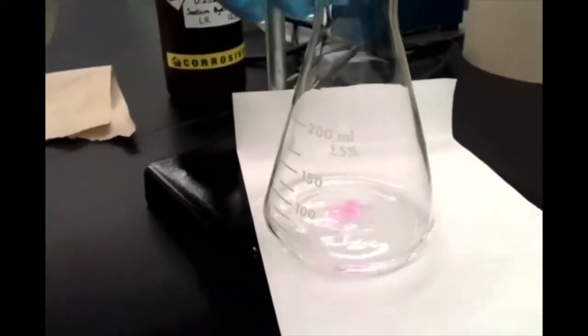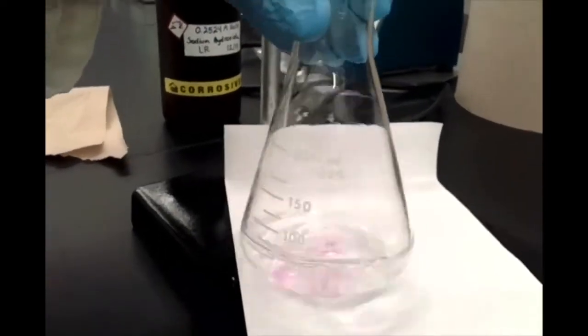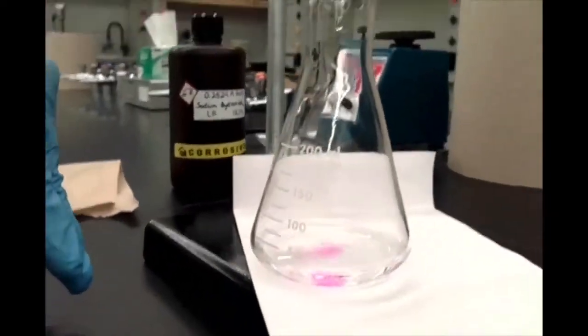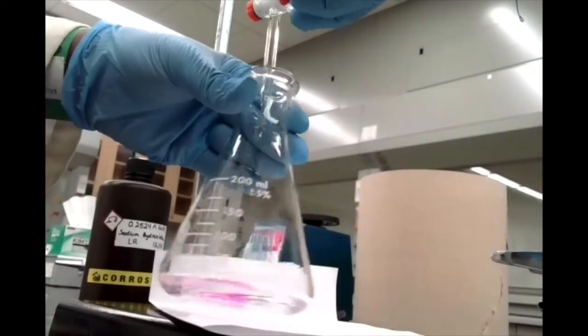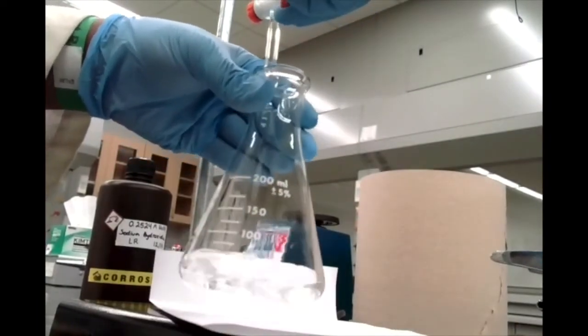All right. So I'm going to go ahead and set this down and just increase our flow rate here, just so that we don't spend forever doing this first titration. Because again, that's the whole idea of doing that first titration a little bit rougher, so that you get an idea of roughly where to aim for.